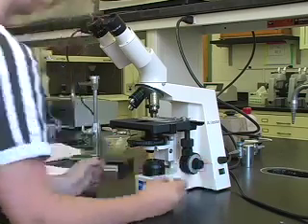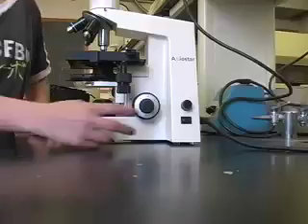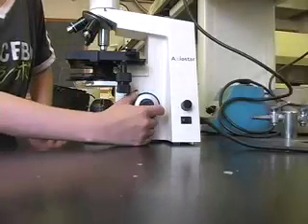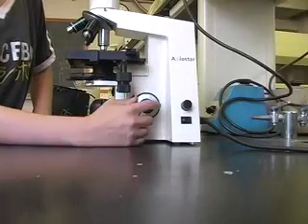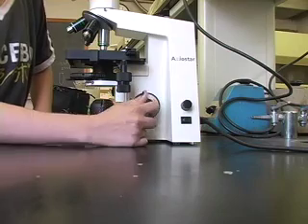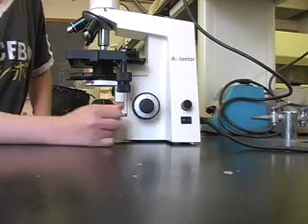Never focus by bringing the stage up towards the objective. Refine the focus with the fine focus knob, which is the knob inside the coarse focus knob.